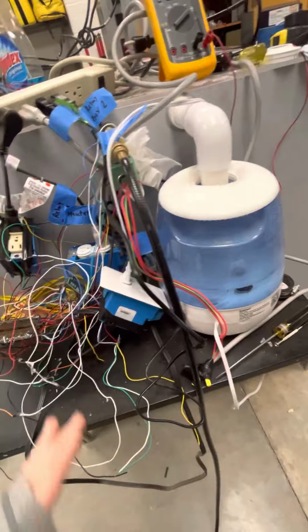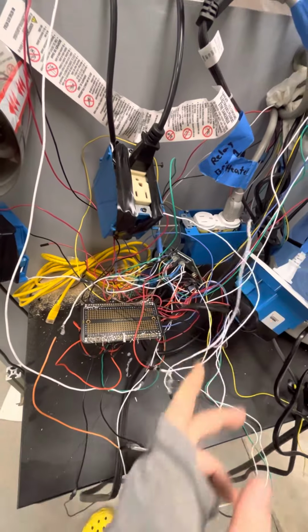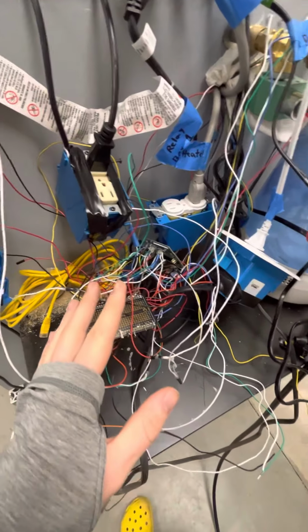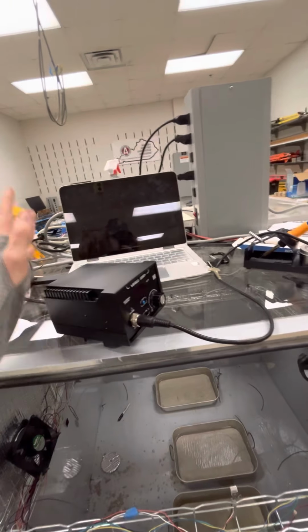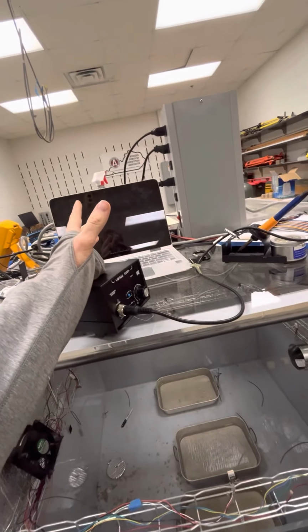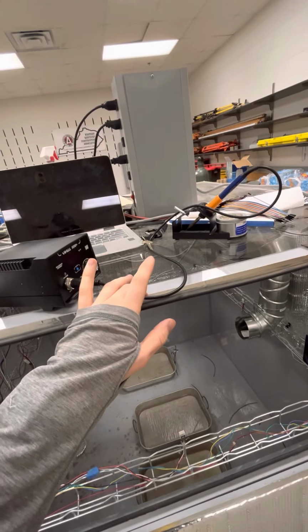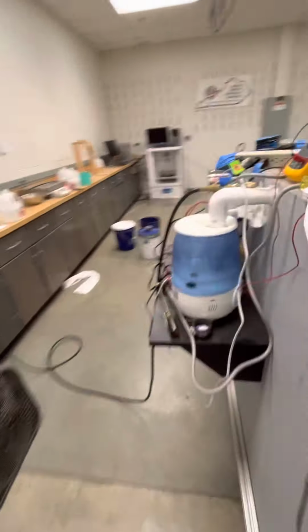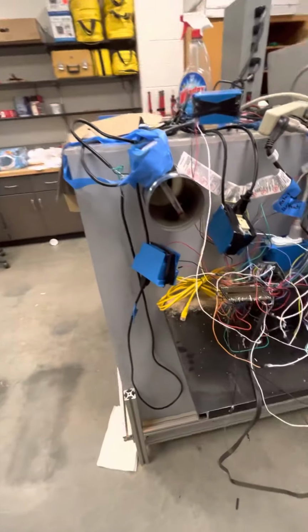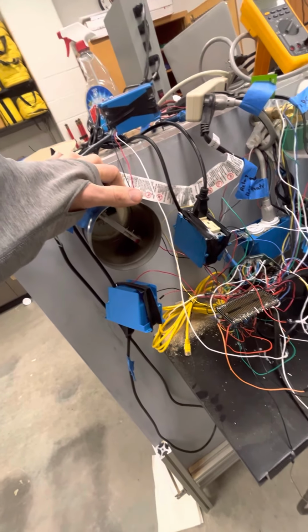All the signals are going through an Arduino for processing. So right here we have an Arduino Uno, and that's measuring the temperature and humidity, and then keeping within a set range that you can set using the program that I developed. And all the data is going to this computer where we have Excel running as a data processing unit. So it's taking all the data from the Arduino and then just typing it out. So you have the live temperature readings, live humidity readings, and live CO2 readings, and also whether or not the chamber is shut. So it's set up for every 30 minutes, this shuts for 2 minutes, and then during those 2 minutes, the chamber is fully closed off.